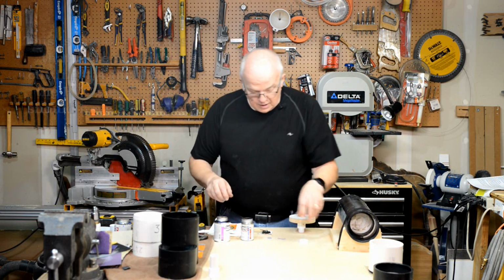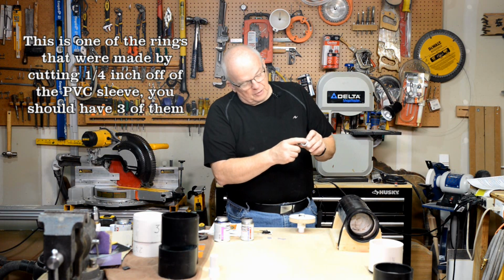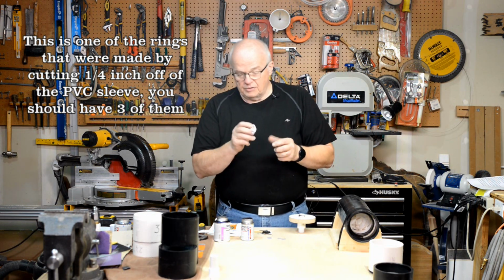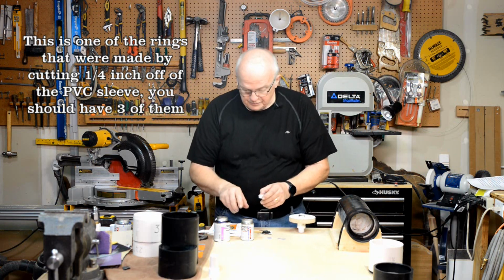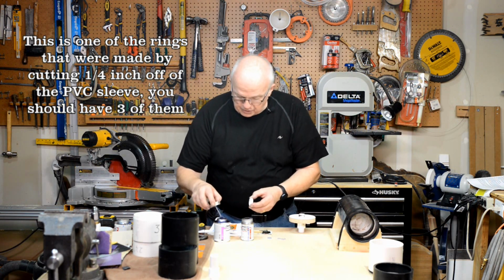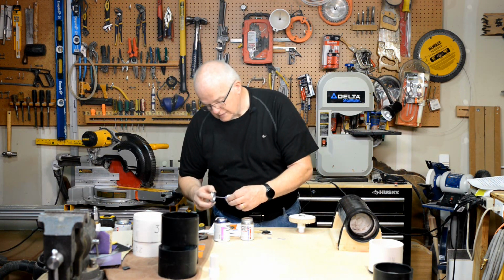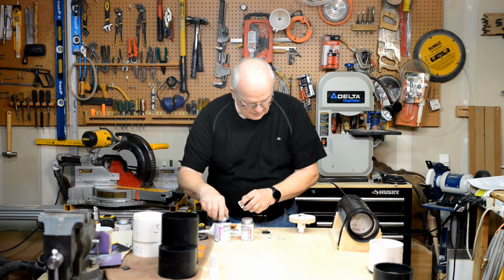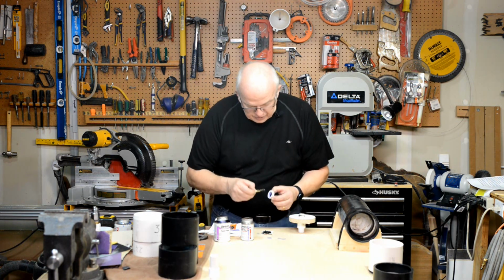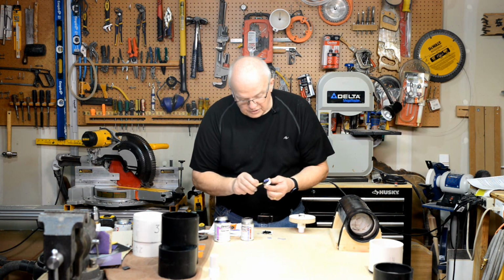That's mixed really well. Now, let's take this ring, and you'll notice this ring, most of them will have the information about the sleeve written on the outside of it. That's going to be the good end. That's the end you're going to want to put down here. This, of course, was cut off of a sleeve, and I'm going to want to put a little bit of primer on it, on the inside. Okay. Now, on this edge that's going down, I need to put a nice heavy layer of epoxy right on this edge.